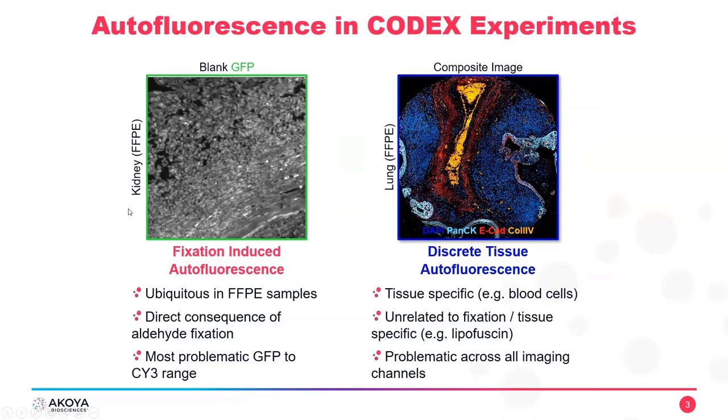So this is kidney tissue. And what we're doing is we're imaging this kidney tissue. It has antibodies on it, but it has no fluorescent reporters on it. So there's no fluorophore on here. And we're illuminating this with a GFP channel. So this is a low wavelength imaging experiment.